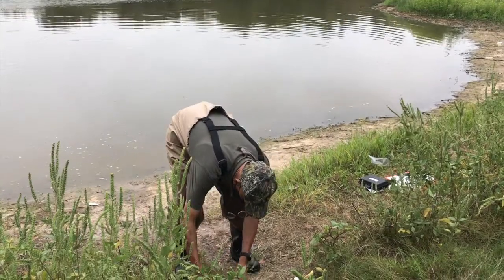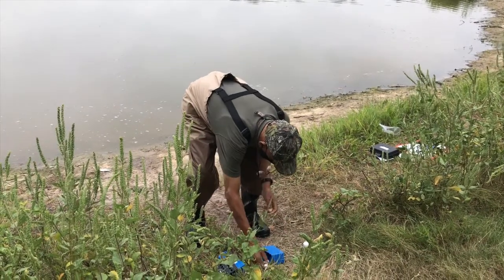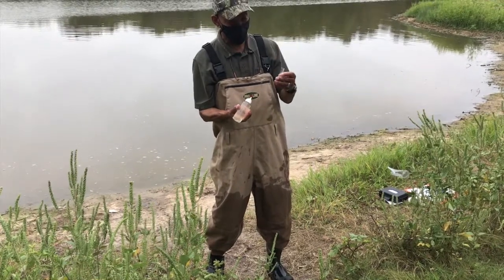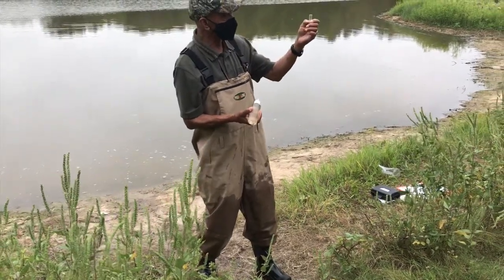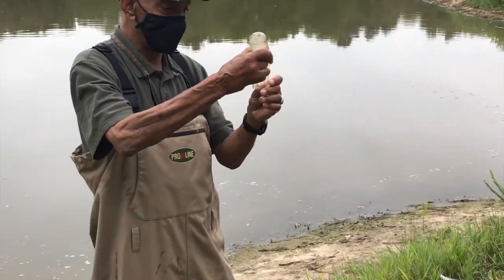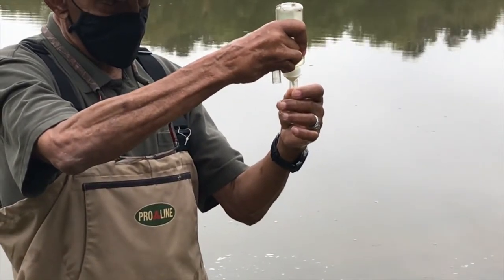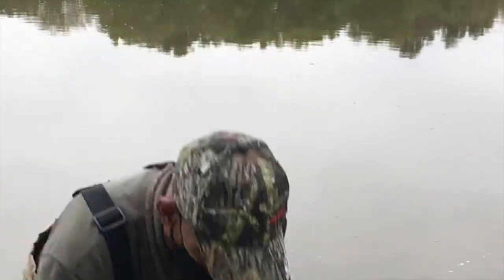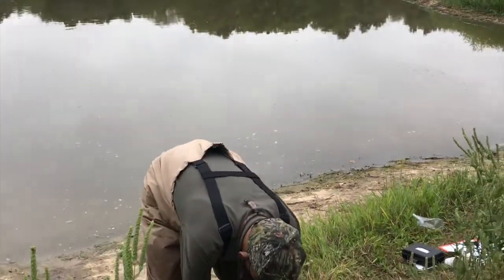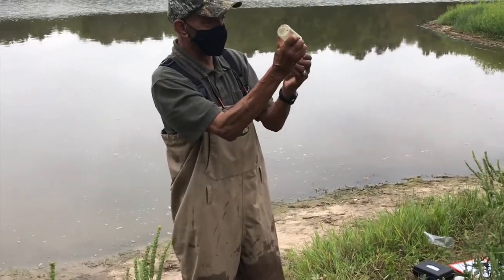In the kit, there are 2 test tubes, and each test tube has a little cap. There's a line that actually measures out 20 milliliters. I'm going to squirt enough of our sample to the 20 milliliter line. I'm just going to cap that temporarily and set that one down, and I'm going to do the same with this other tube. 20 milliliters is what we're looking for.